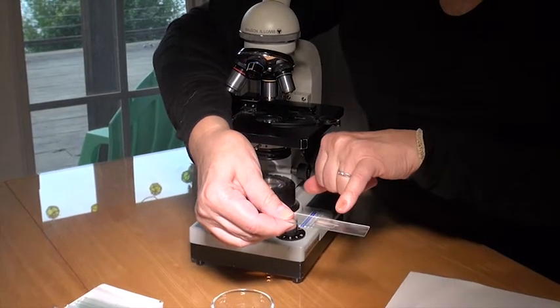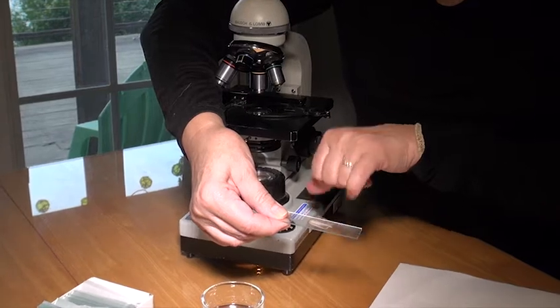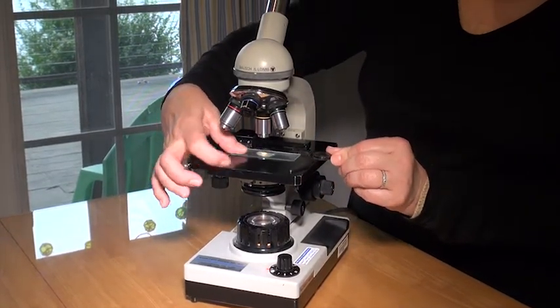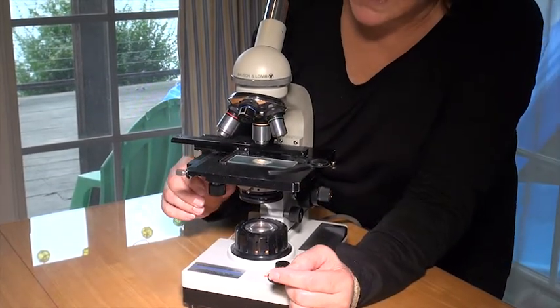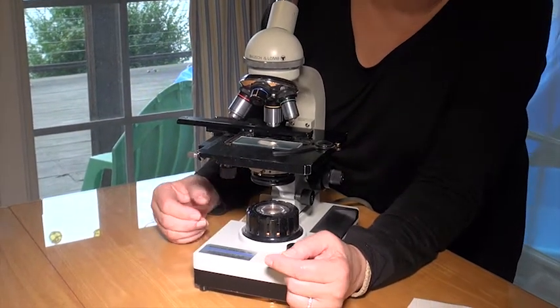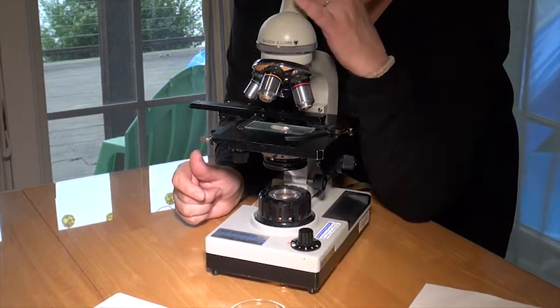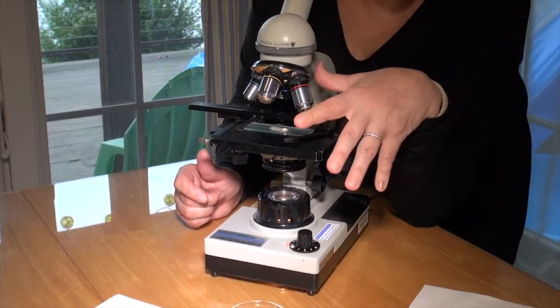On this slide I'm going to focus right here. That's too thick, but that part looks thin enough. Straightening out my cover slip. Stage is down. Using the slide clip to secure the slide. The carriage is still in place from our letter E. I'm using my slide adjustment knobs to get it in place before I even start. I'm not going to start at high power — I'm going back to low power. Looking through, I see absolutely nothing. My light is still at the good setting we used before.